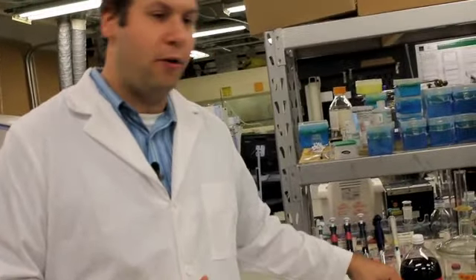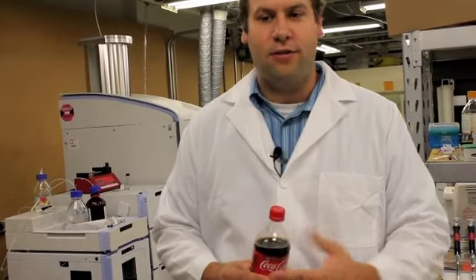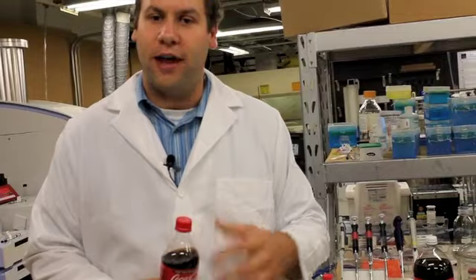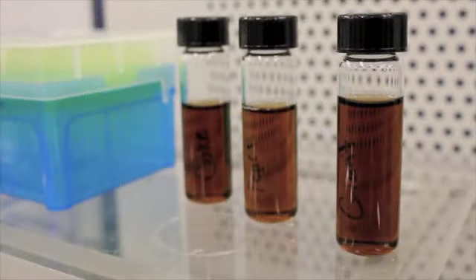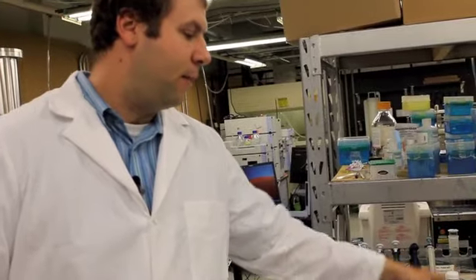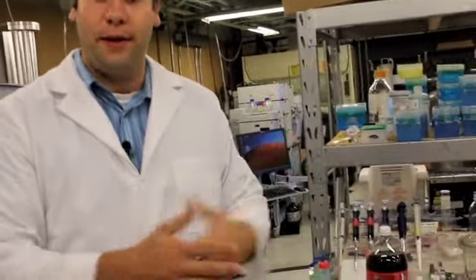If you're looking for Coke, we would run Coke as a standard, we would save it, we would figure out what masses are associated with Cokes, and then we can start to run the unknowns and we can pick the Cokes out based on the peaks that we get. So we'll run a Coke, we'll run a Pepsi, and we'll run a generic. And once we run that, we'll have a unique fingerprint to come back to and say, this has a unique mass at this M/Z. This will have a unique mass at this particular number, and then this one would have a unique mass. And then we would run all three, and then whatever the peaks are, we could start to pick it out.